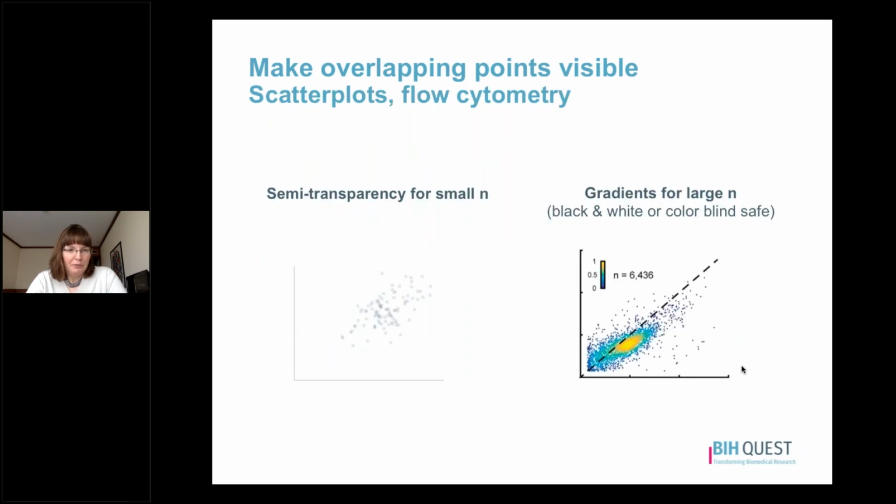Let's talk now about strategies for scatter plots and flow cytometry plots. These graphs are a little bit different because we have measured values of continuous data on both the y-axis as well as the x-axis. So this value on the x-axis is a continuous variable. It is not a group. And that means that we cannot use the random jittering strategy because then we would actually be moving the measured value of the data point, which would be an inappropriate manipulation.